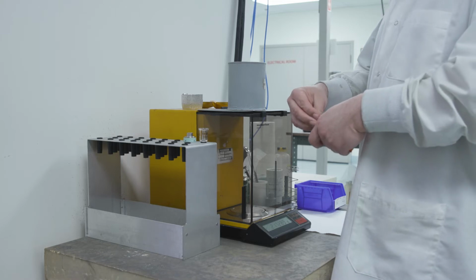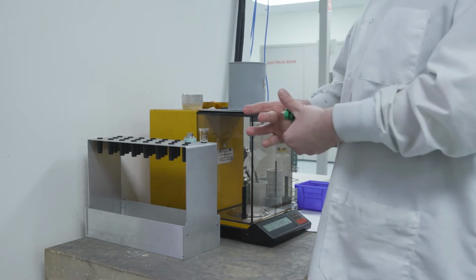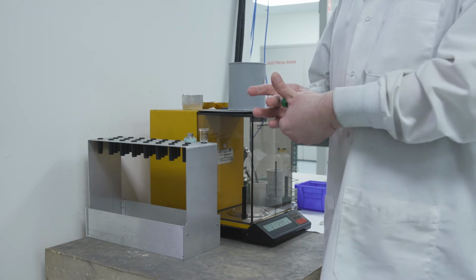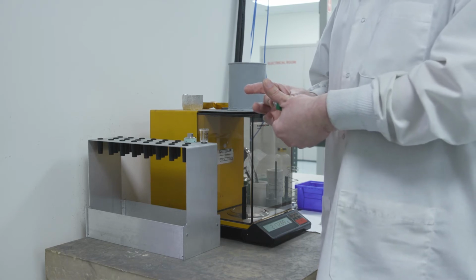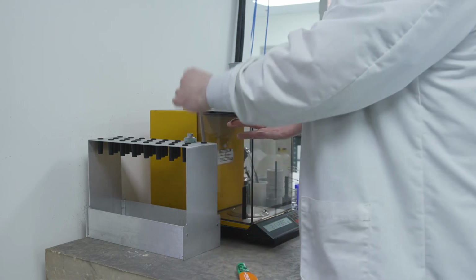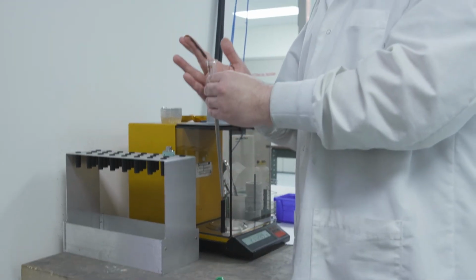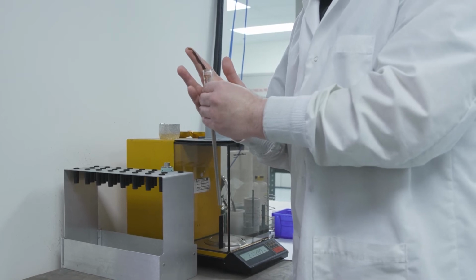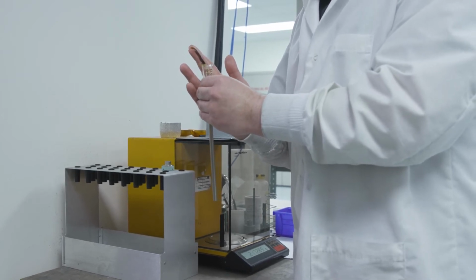As with preparing a sample for analysis, we need to seal the penetrometer, only this time doing so without adding sample. Chris starts with a line of Apiezon H grease on his finger, then applies it to the penetrometer by rotating and lifting the top of the penetrometer along the line of grease on his finger, effectively removing most of the grease and transferring it to the sealing surface of the penetrometer.